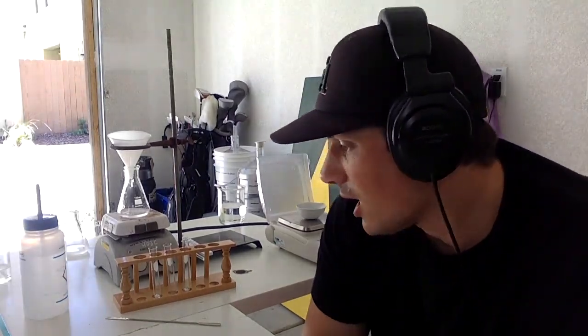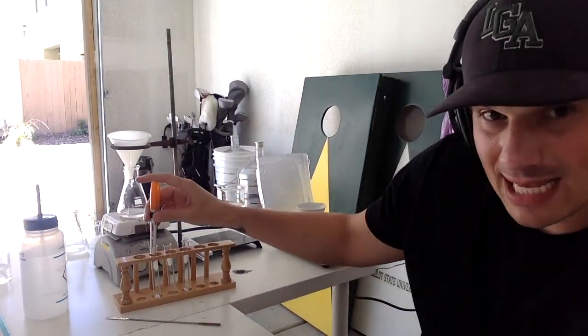There is one other thing that I need to do with you guys, and that is our iron test. The iron test in this case is used to determine if there are any phenols in your sample. So we're going to use a control in this case. The control that we're going to use is the salicylic acid. That does have that OH, that hydroxyl group, which is the phenol when it's on an aromatic ring. That is right here. This is salicylic acid.